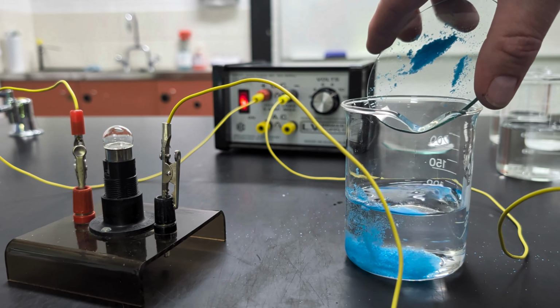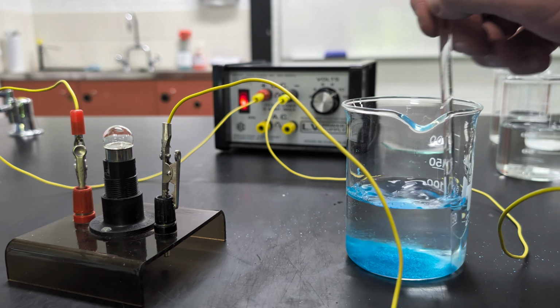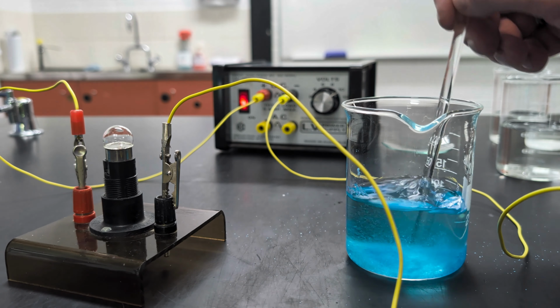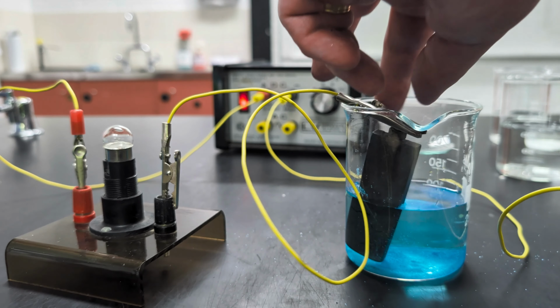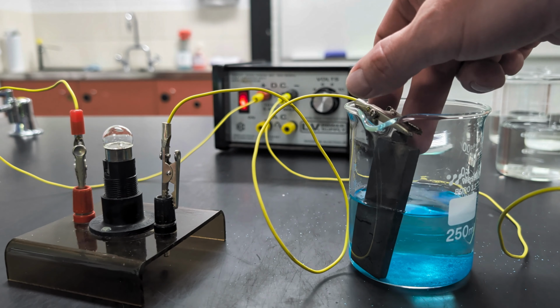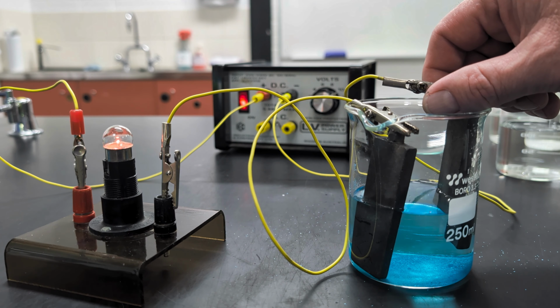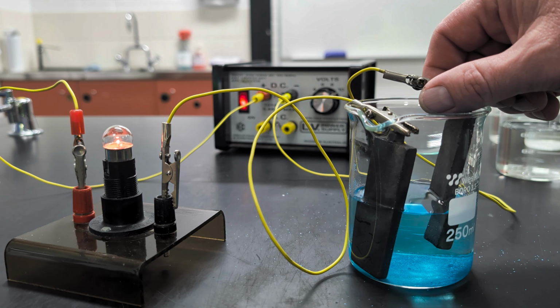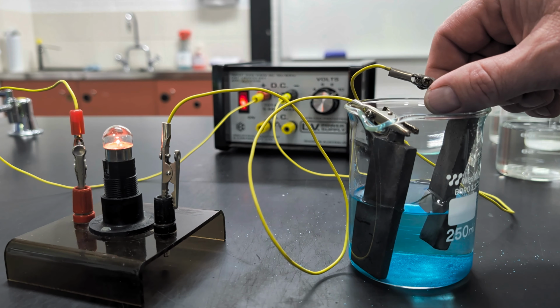put it into our water. Give it a bit of a stir up to help some of those ions dissolve, to be pulled out of the lattice. And now, because we've got ions removed from the lattice, they're free to move throughout the solution. That means they can flow, so we can have a flow of charges, which is electrical current. And sure enough, the lamp is glowing. You'll note not as bright as with the salt, with the sodium chloride. Certainly not as bright as if I just touch the electrodes, but it is glowing.